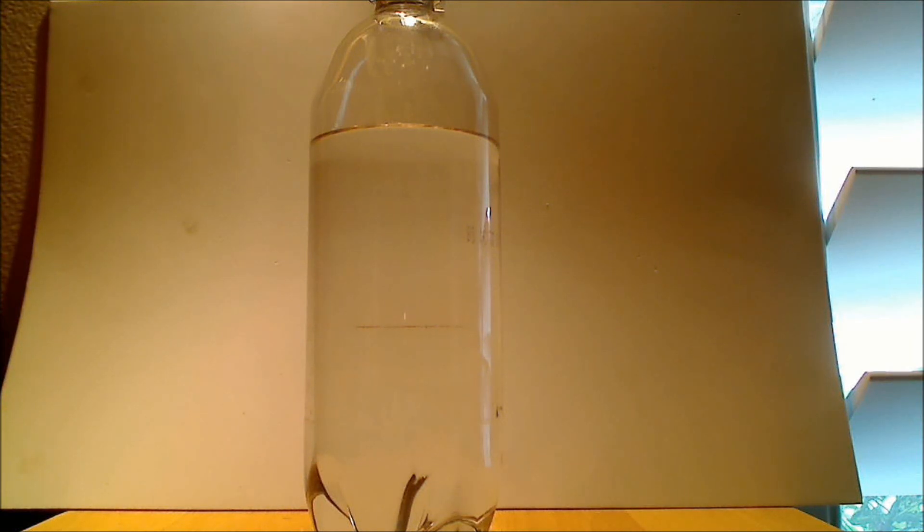I have a bottle here that looks like it has a single liquid in it. But let's take a look at it. I'm going to shake it up first.